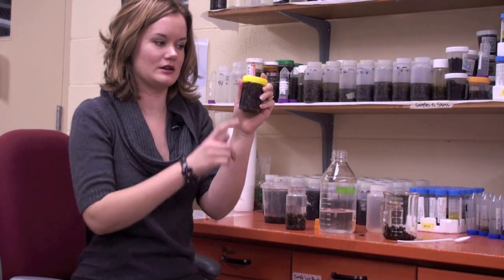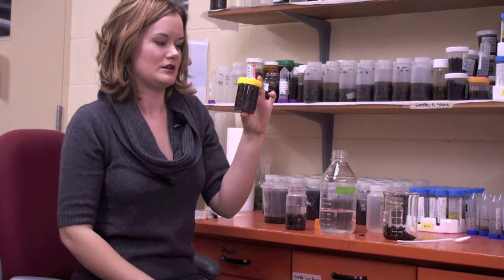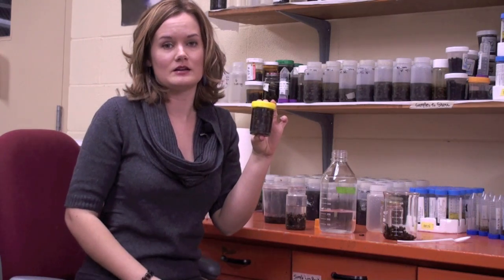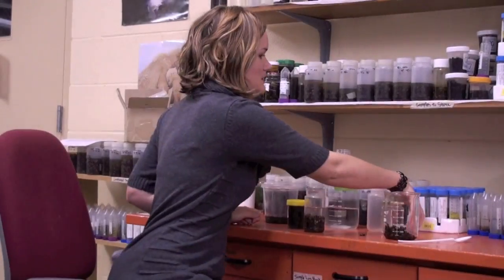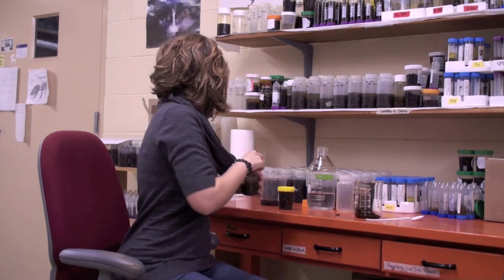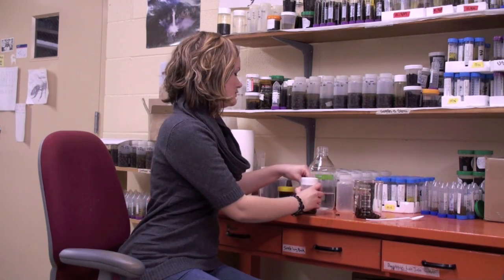I need the alcohol covering about an inch above the line of bees. If the bees are completely up to the top and they've soaked up all of the alcohol, then the bees will rot and your data will not be accurate. So it's really important to have it filled properly. The next step is to put the lid on really tight so none of the alcohol comes out when it's shipped. If you have it available, I also prefer wrapping wax paper around the lid — that's just to reinforce it.